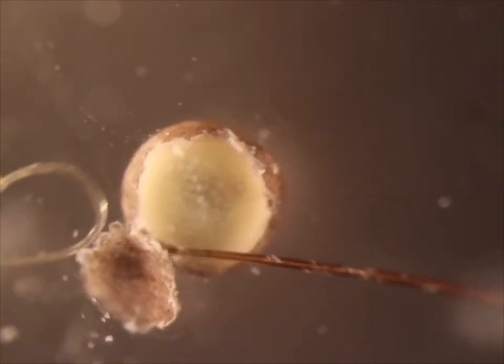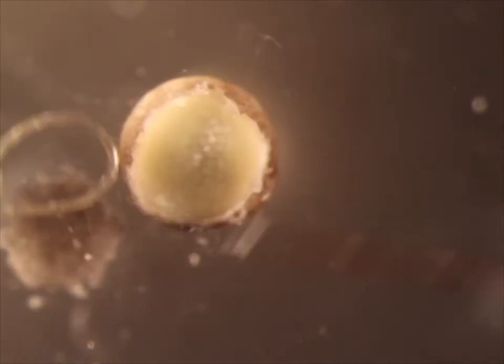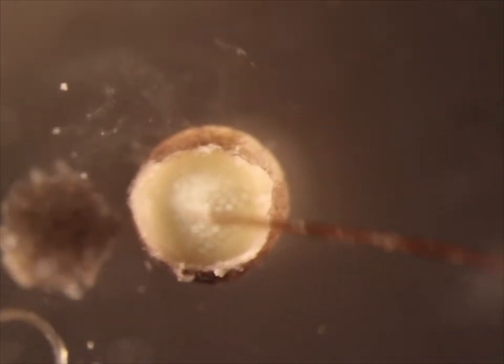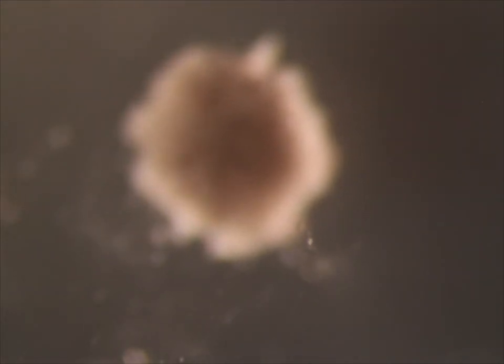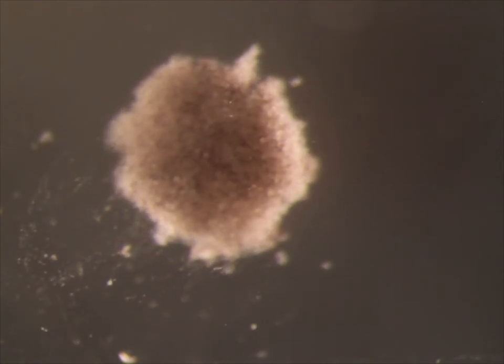This should then be gently brushed off of the embryo using the hair tools. Often you will need to trim the explant of ragged edges, so refocus on the explant.